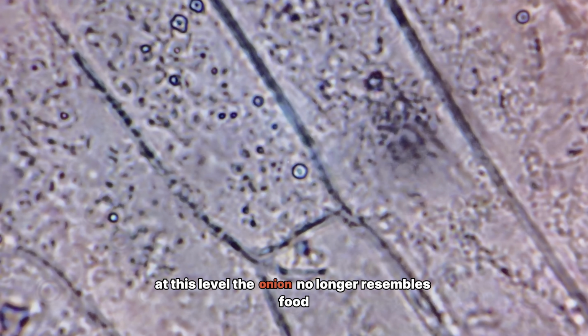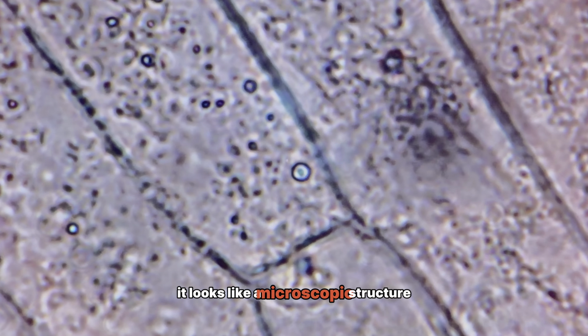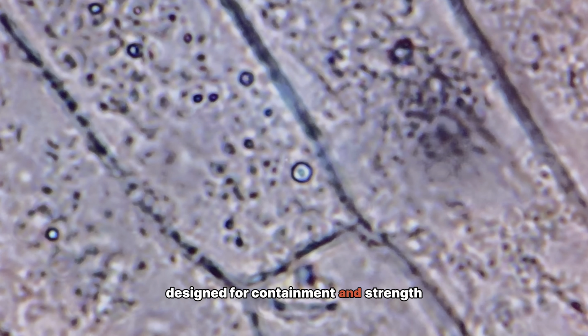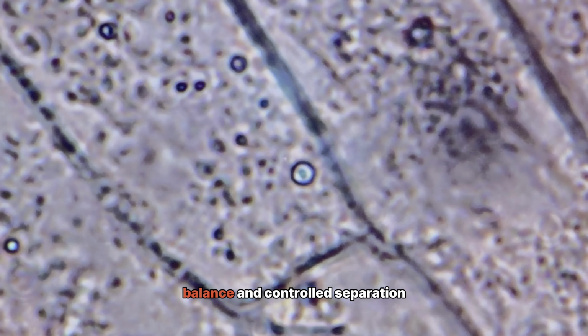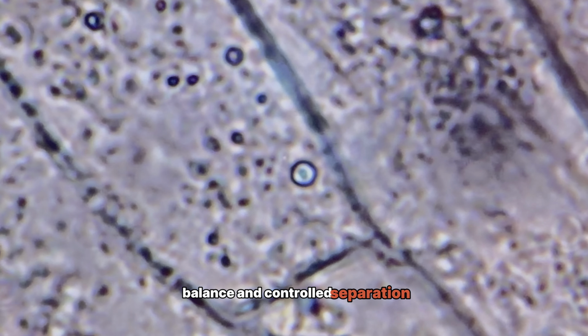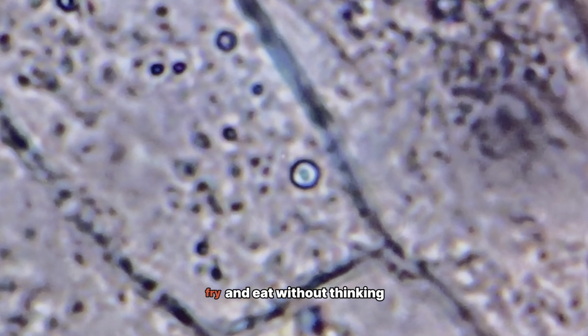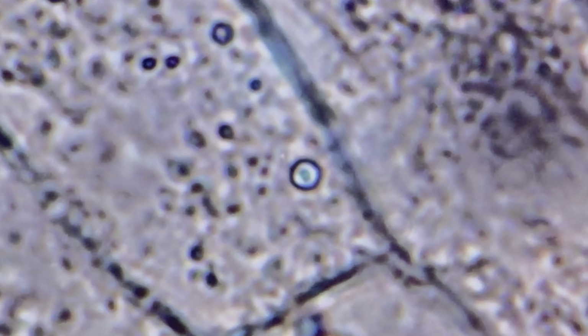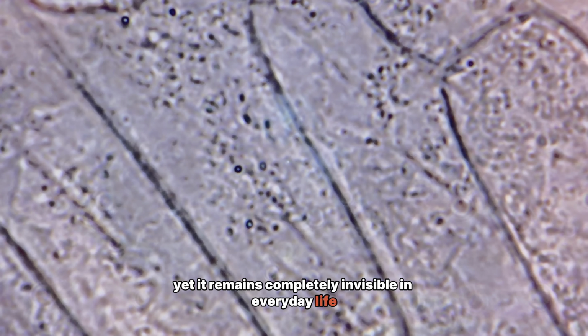At this level, the onion no longer resembles food. It looks like a microscopic structure designed for containment and strength. A system built from repetition, balance, and controlled separation. This hidden world exists inside something we slice, fry, and eat without thinking. Yet it remains completely invisible in everyday life.